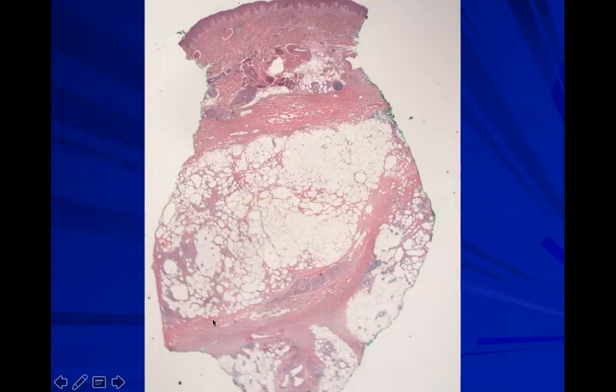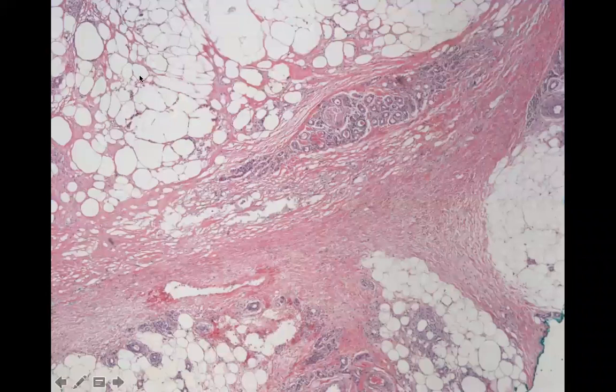So here is a picture of lipodermatosclerosis, and you can appreciate, hopefully from low power, that you have a lot of fat necrosis here and fibrosis of the septum, but not a lot of primary inflammation. It doesn't look like there's active granulomas or anything that we would expect in erythema nodosum. And so going in close, you could see this sclerosis even extends into between the lobules of fat, and it involves here the dermis, where there's a little fibrosis and a little sclerosis, and we're going to talk a little bit in the next section about what the difference is between those terms.